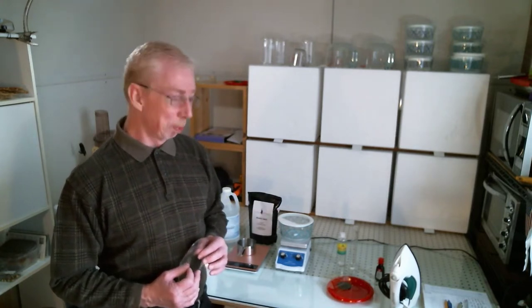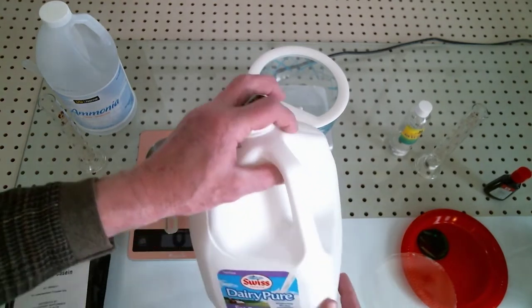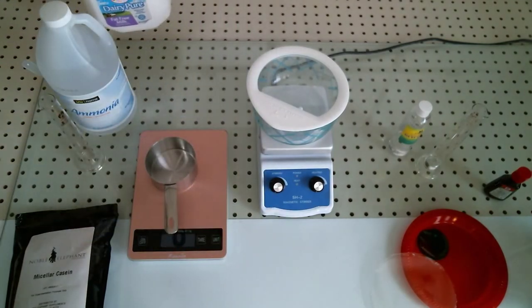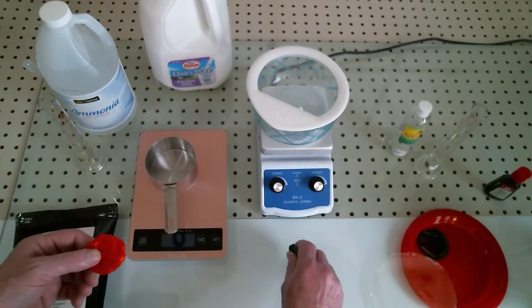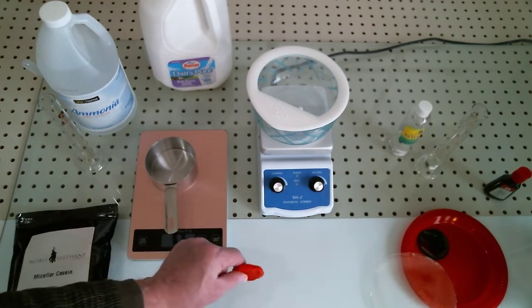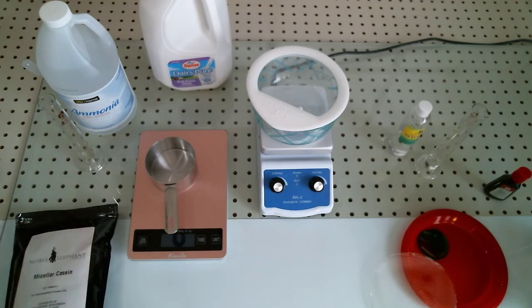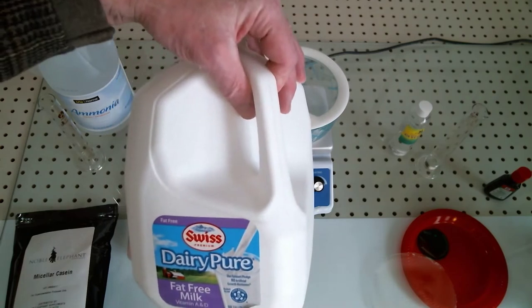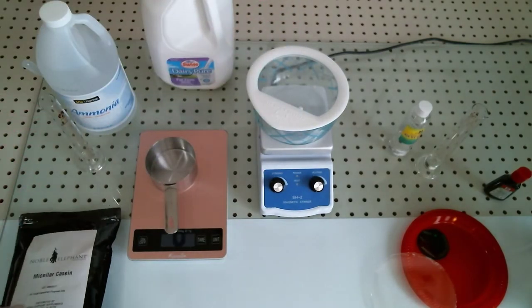Now you've seen me make Galalith in a previous video. Last week we made something very similar where we made two different kinds - the hard and the flexible. You can certainly precipitate casein from milk in a process that I've shown you a couple of times.